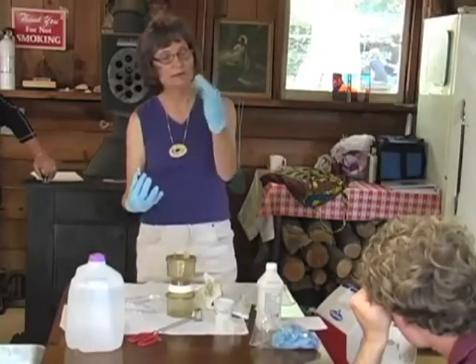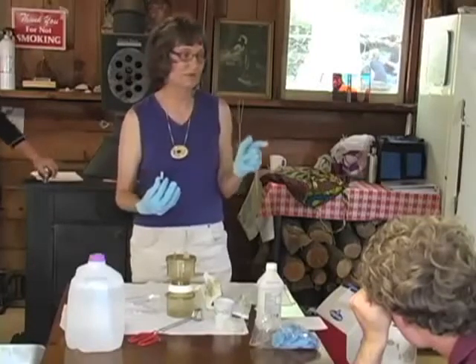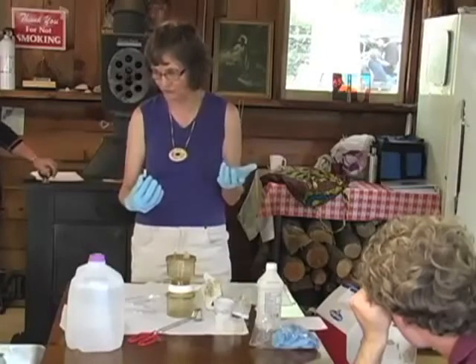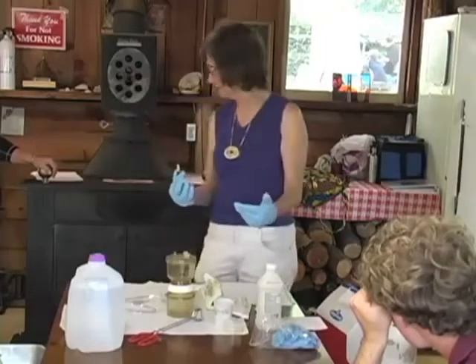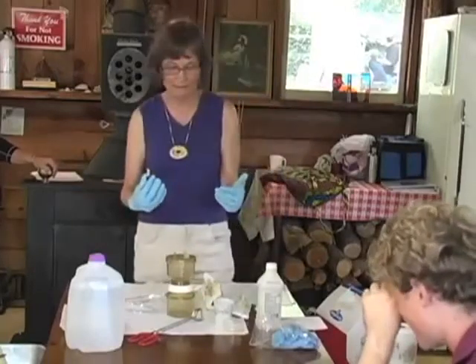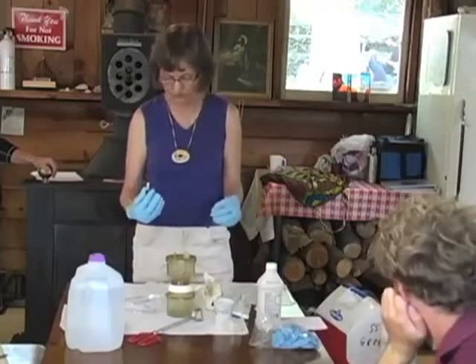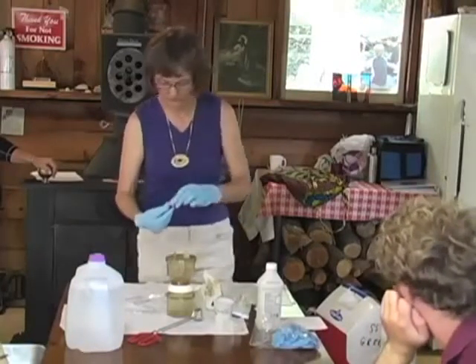And these are so big, I can hardly do anything in them. But some of our tests do have caustic and acidic chemicals, so we usually have the students wearing both gloves and goggles. If the water was known to be contaminated, you would want them to wear gloves and also wash afterwards. So you can prevent cross-contamination both ways.